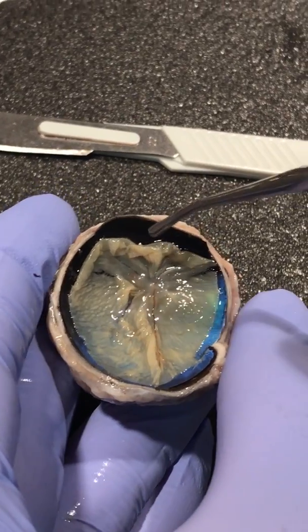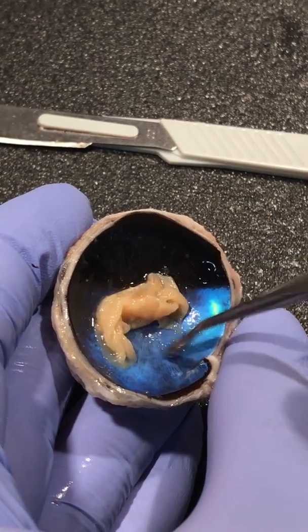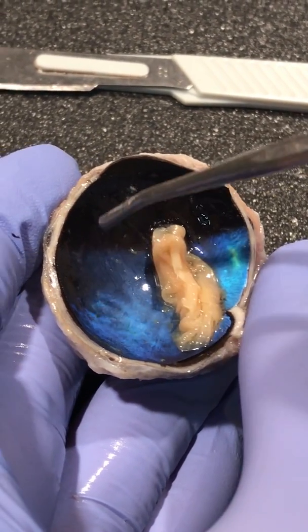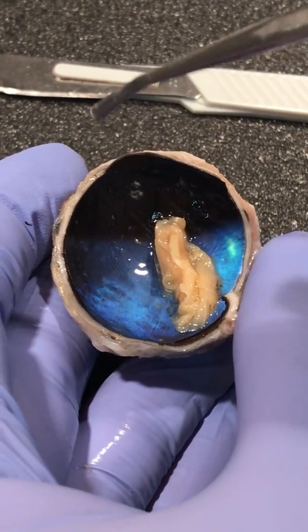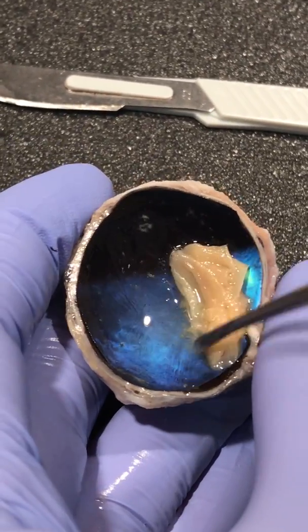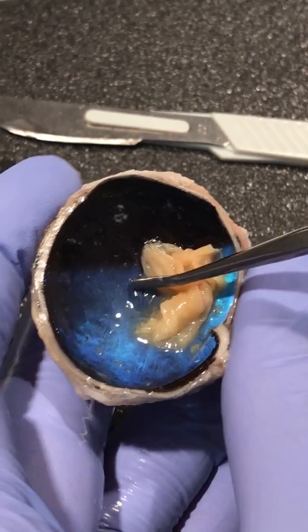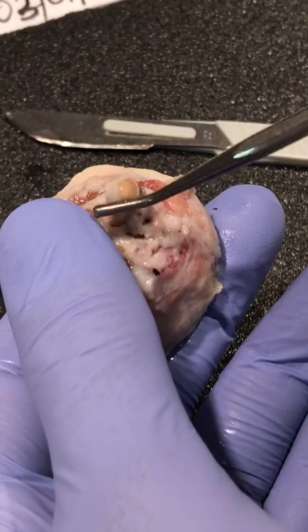And then if we remove that, the only part that is not removed from this back part of the eye is called the optic disc, or the optic nerve. It's the point of exit for ganglion cell axons leaving the eye. All those sensors that we have in the retina, these axons exit the eye through this entry, which is called the optic disc, and it forms the optic nerve right here.